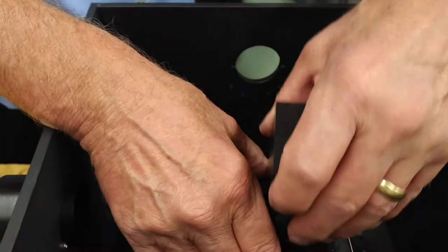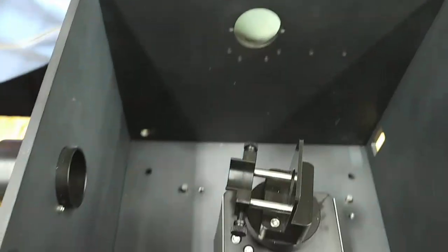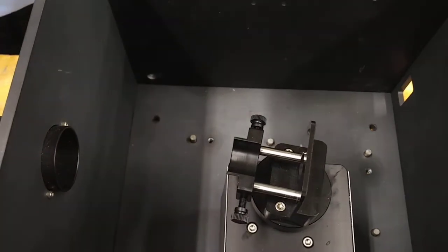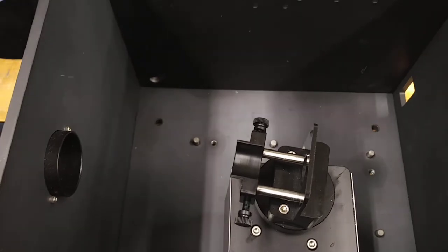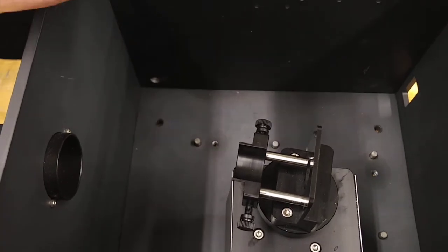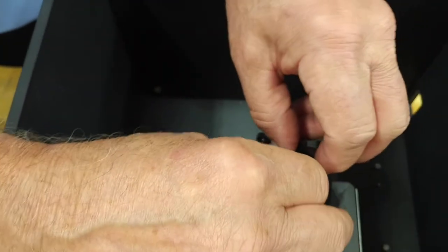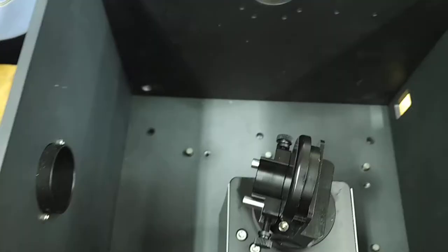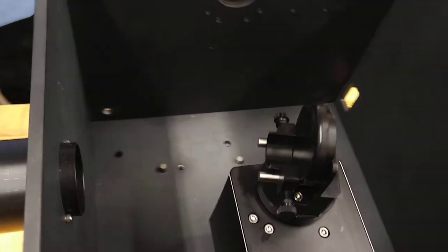Okay, and then we're going to transition to a round piece of a certain thickness and just put that in place.